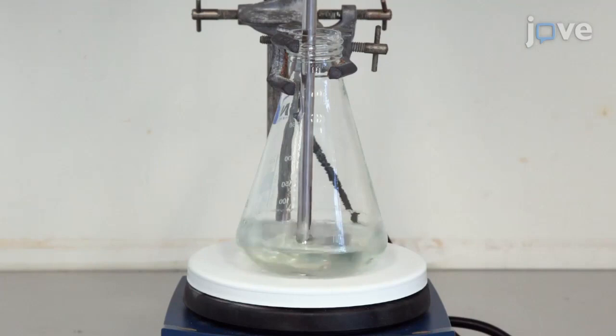Add 100 grams of pentaerythritol tetraacrylate and 100 grams of multifunctional epoxy acrylate to the mixture.